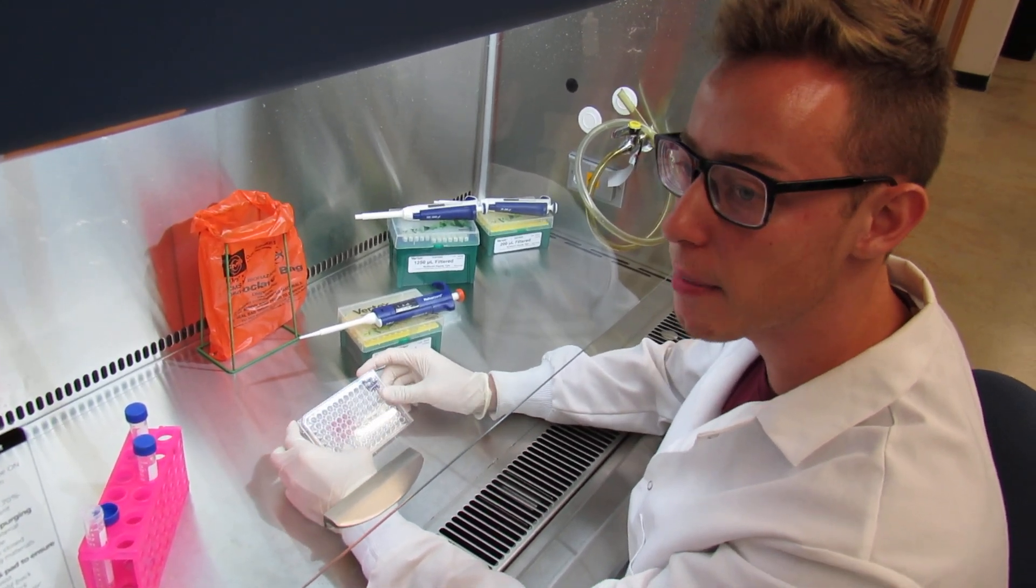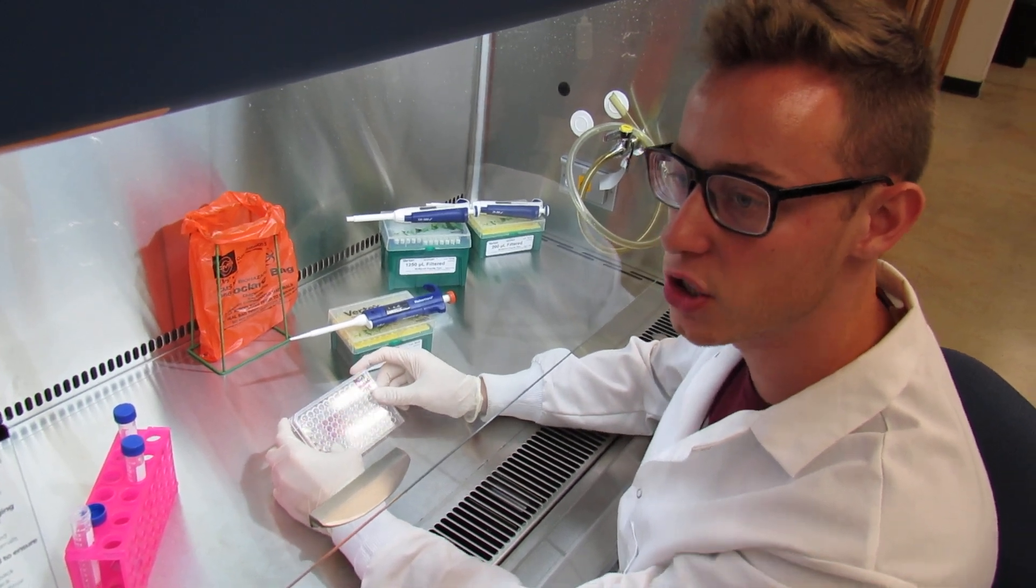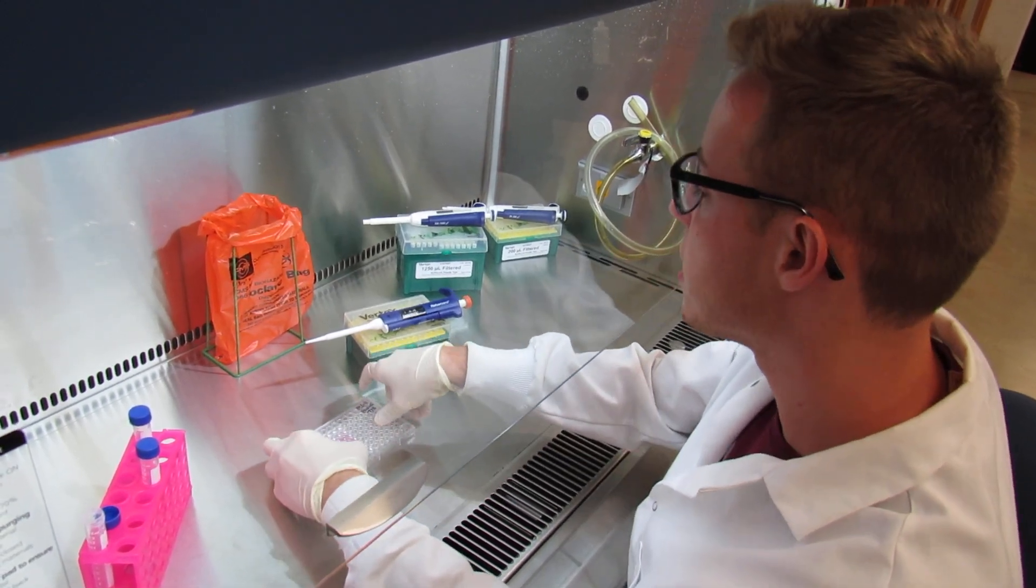Again, we are only working with DMSO today, however you'll have different concentrations of toxins to work with in class.